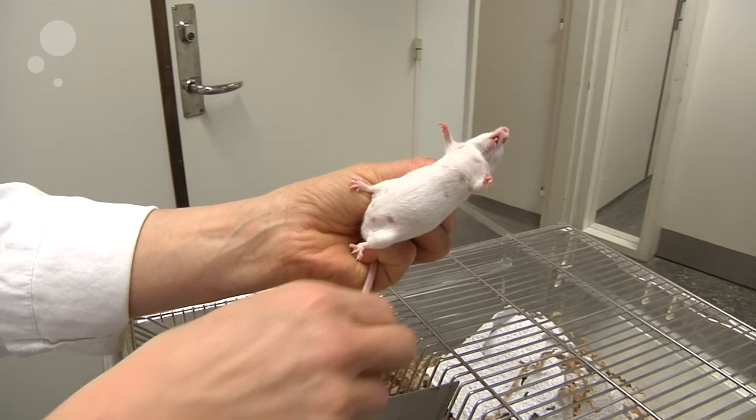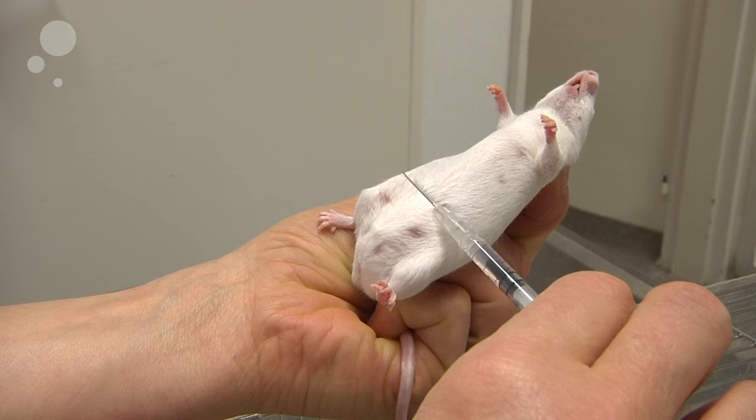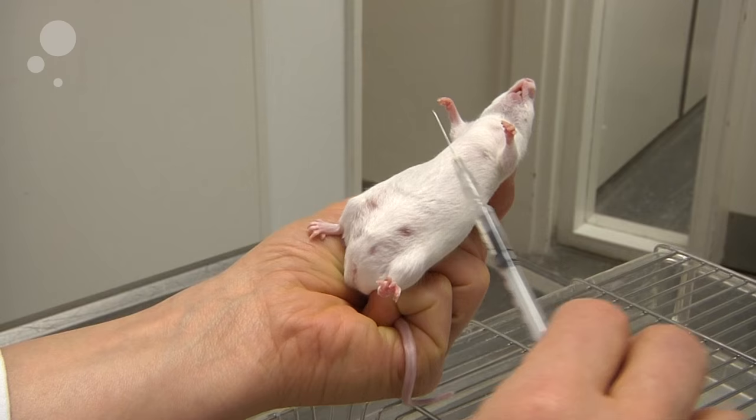Then you will identify the midline of the abdomen, the upper boundary and the lower one, and draw an imaginary midline across the abdomen. In the upper part you will have the liver and the stomach, which we should avoid, and in the lower part you will have the bladder area and the cecum on the left.